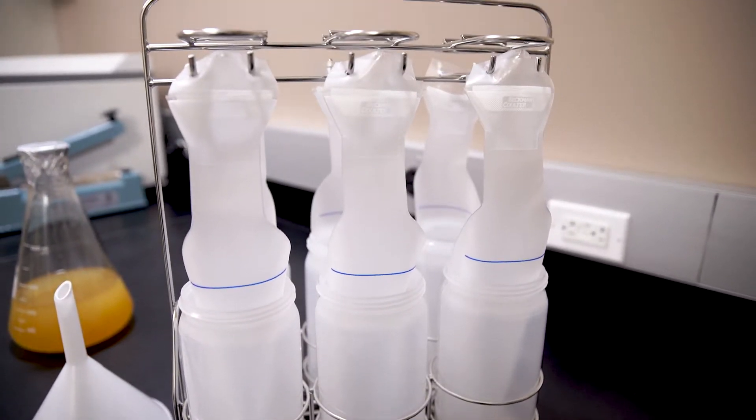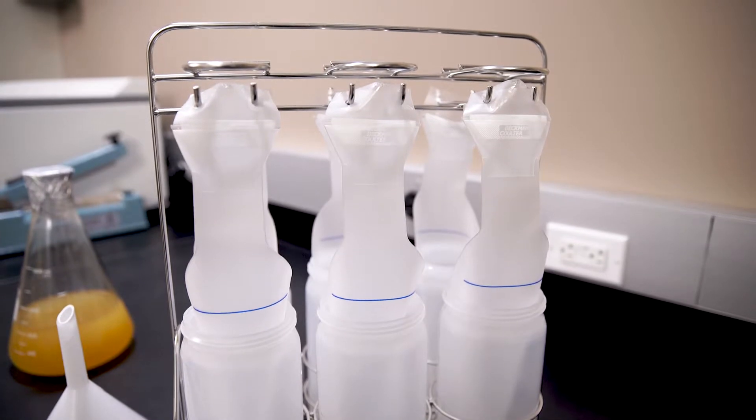Harvestline system liners provide a convenient method of loading, recovering, and storing samples.